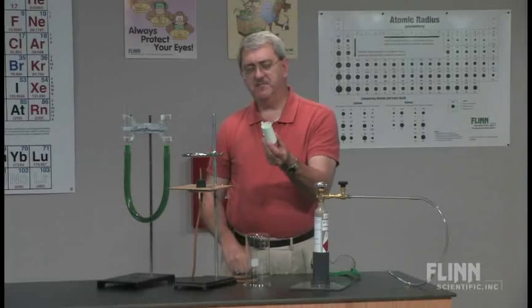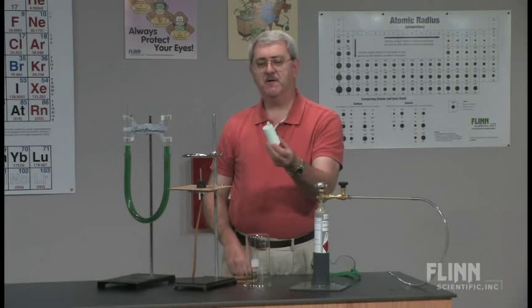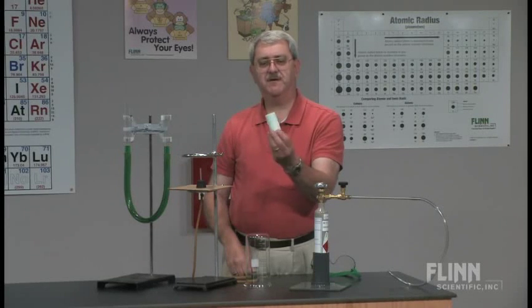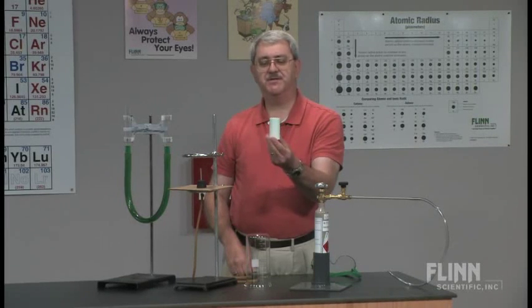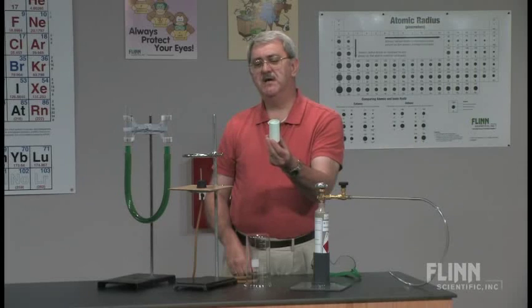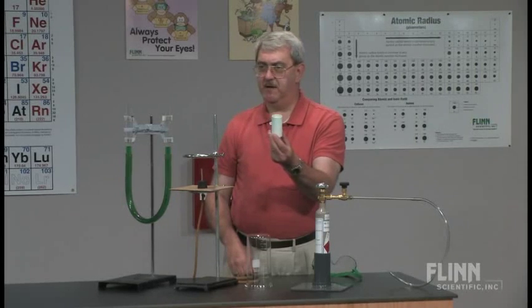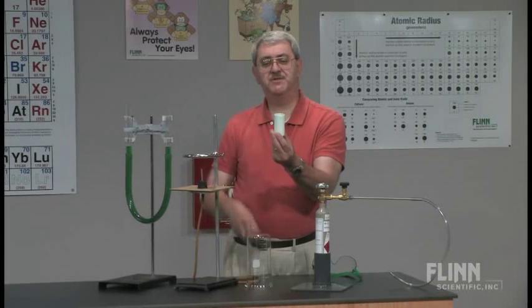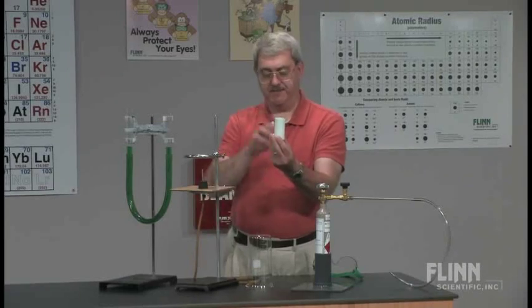You may find this mixed in with your electrochemistry materials because it's often used in creating a battery. You put solutions in here and it acts as a barrier.